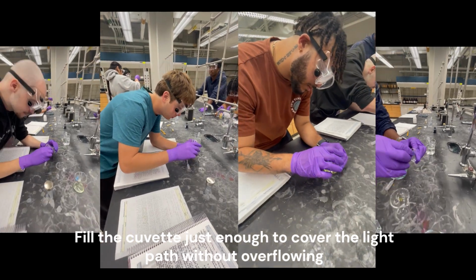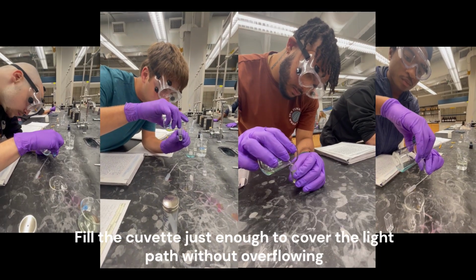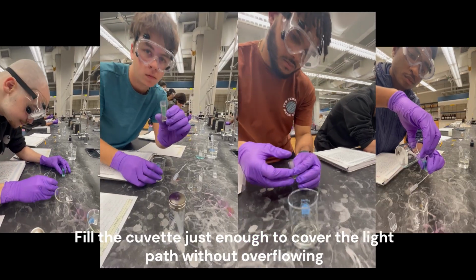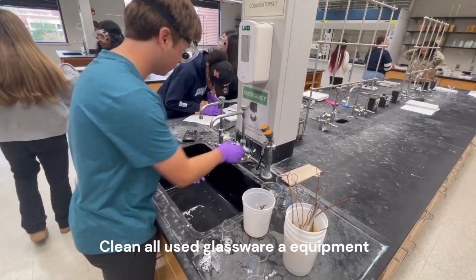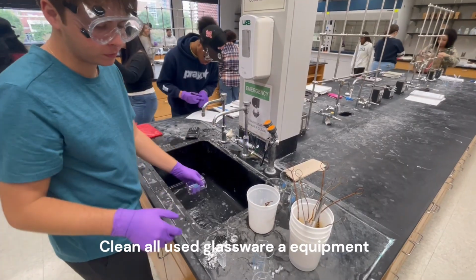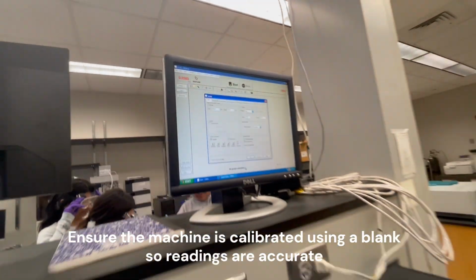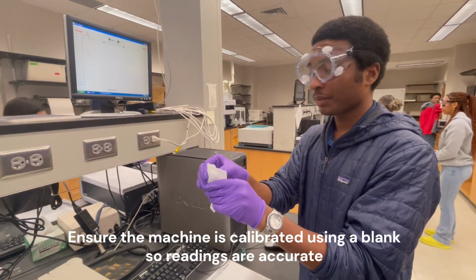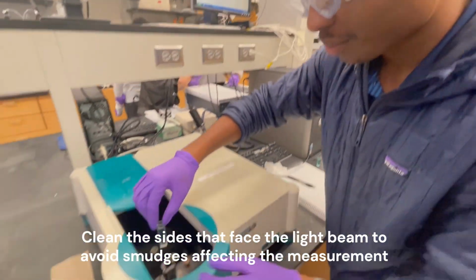Alright, you good. Wow. Alright, good. Yeah, these are all washed. Good enough. I see that it's at 800 to 200. Yes. He needs to put it in. Is it 0.74? Yeah. That's what I said.